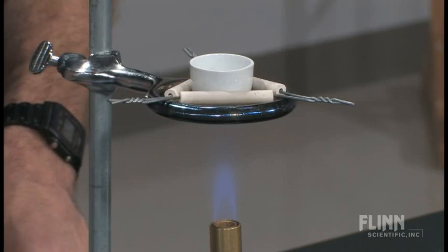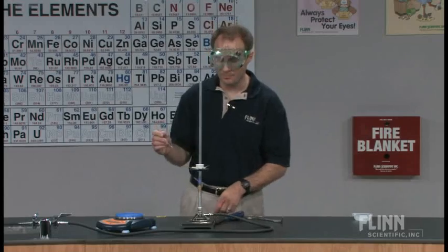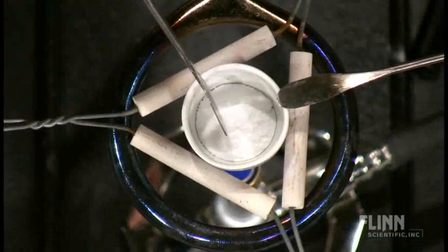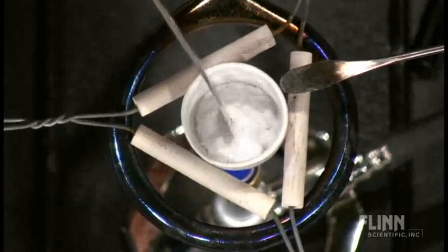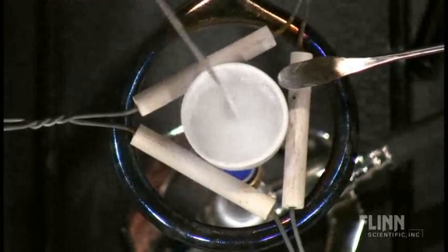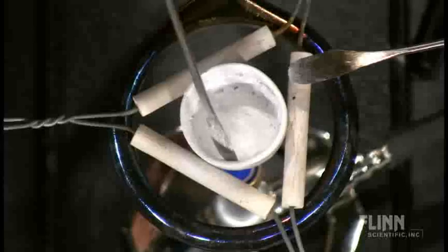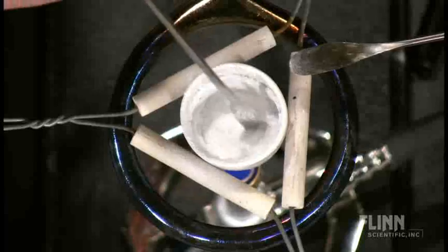After a few minutes, what I like to do is have the students move the baking soda around so it doesn't clump up. To do that, you want to use two metal spatulas. You can see it almost looks like a snow-drift type of effect going on — as that decomposition process occurs, it looks like blowing ultrafine snow in the wintertime.